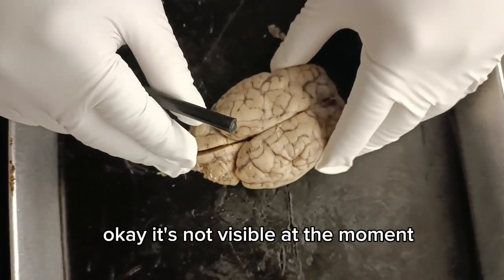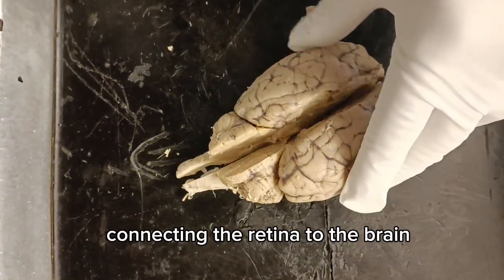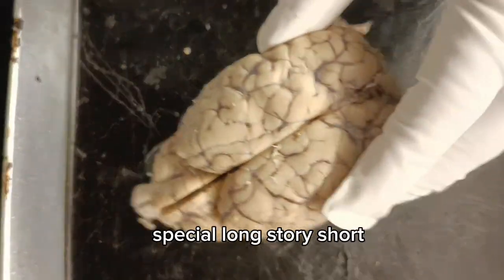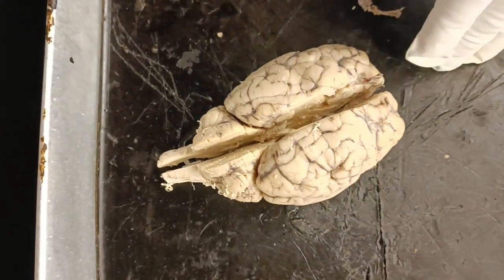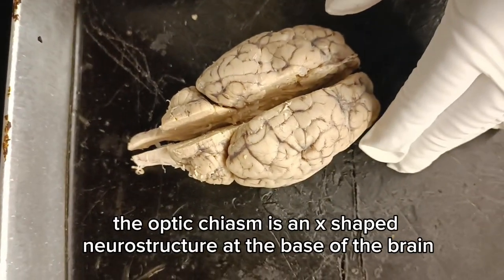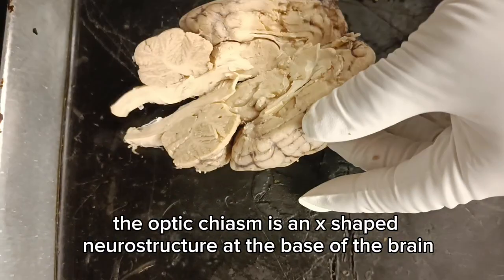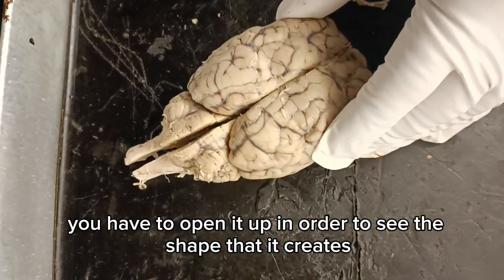Okay, it's not visible at the moment, but the optic nerve is the communication cable connecting the retina to the brain's visual center. Long story short, that basically is what allows your brain to see. The optic chiasm is an X-shaped neurostructure at the base of the brain. Can't really see it right here. You have to open it up in order to see the shape that it creates.